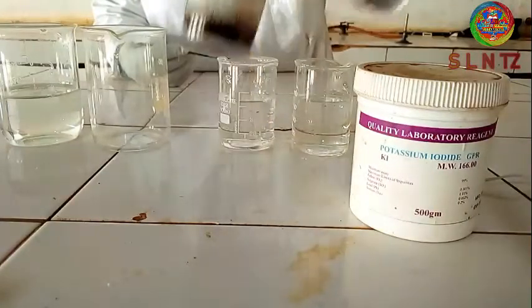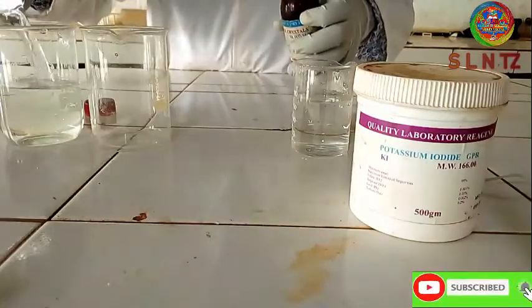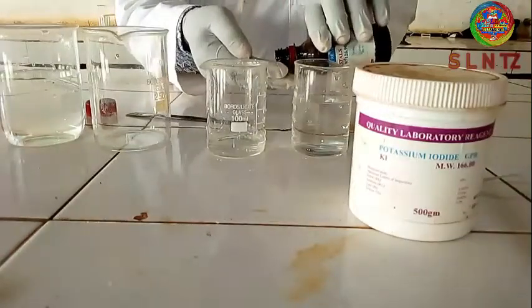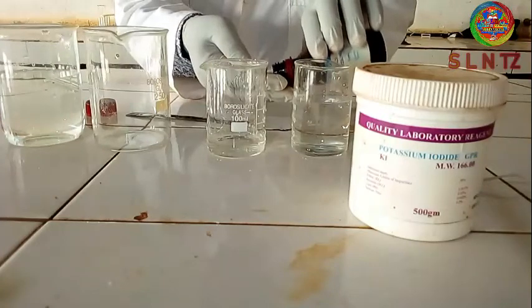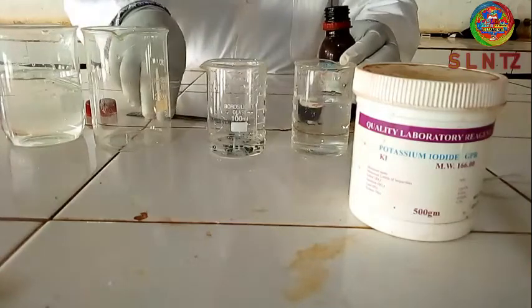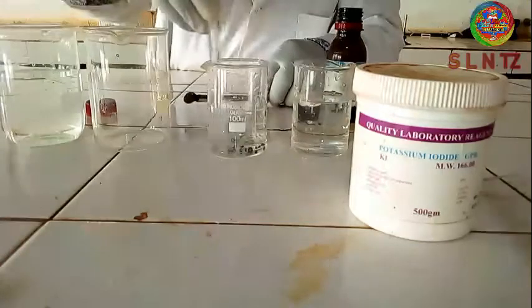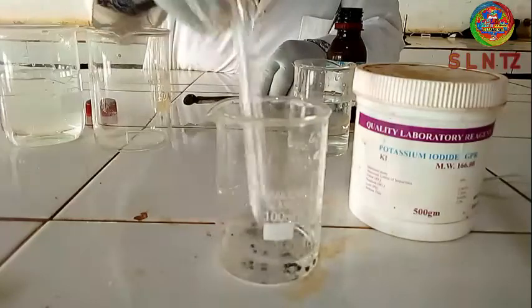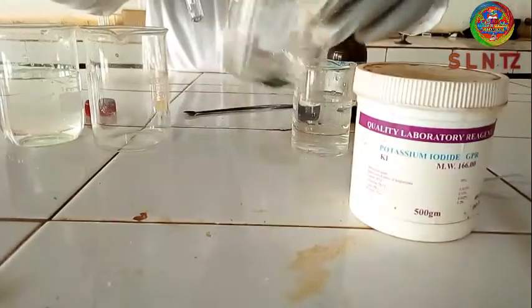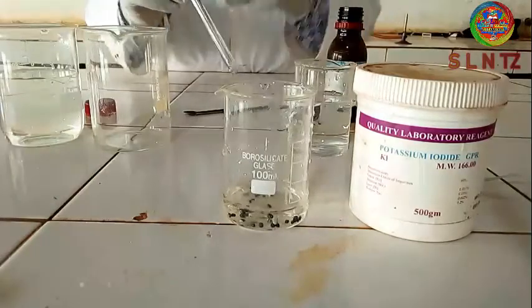Let me show you that iodine crystals do not dissolve in water. As you can see, they do not dissolve in water at all. So in order to dissolve iodine crystals, you have to first dissolve potassium iodide.